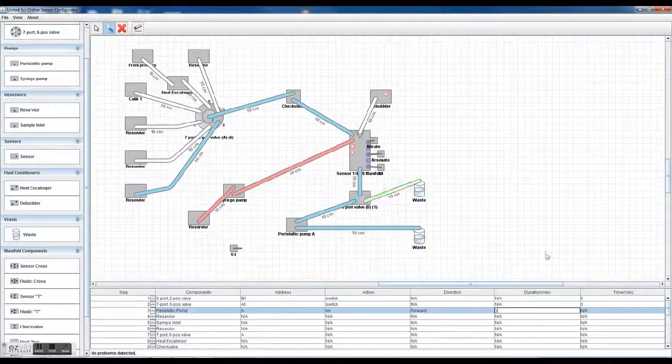And we're coming up with calculators here so that some of this will be automated. So you can see that you're able to really go through and actually program it out and then visualize it as you're doing it. All right, so that's the bottom line.